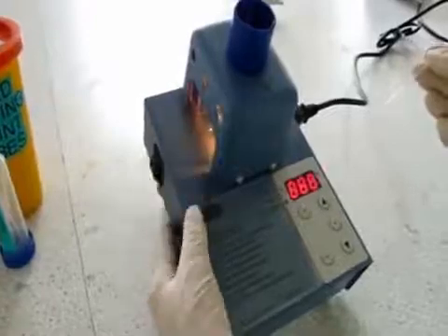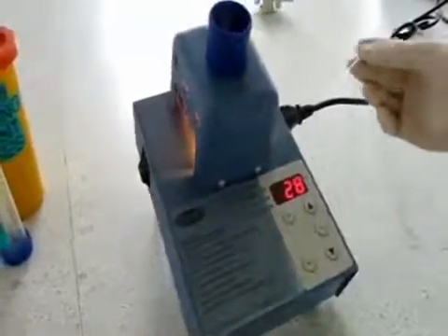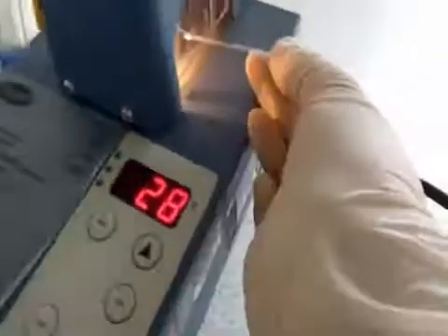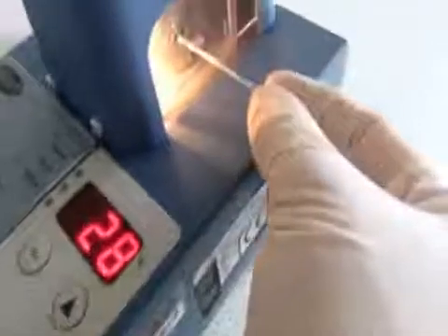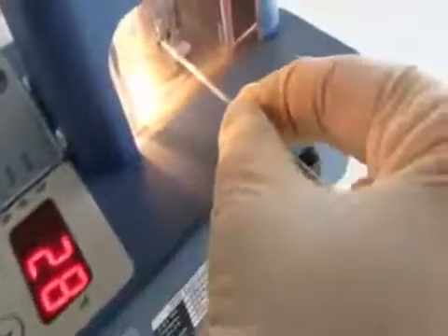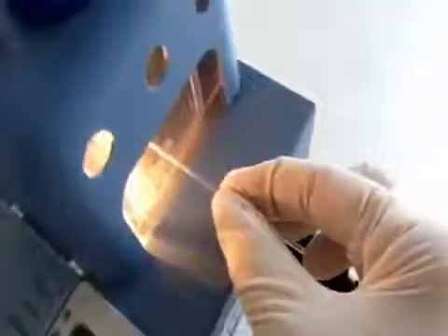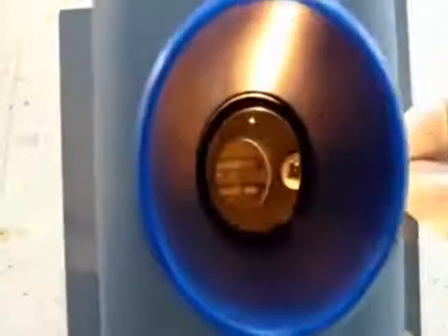Turn the melting point apparatus on, place the capillary in the melting point apparatus, and ensure that the sample is visible through the viewfinder. Never put the open end into the apparatus.